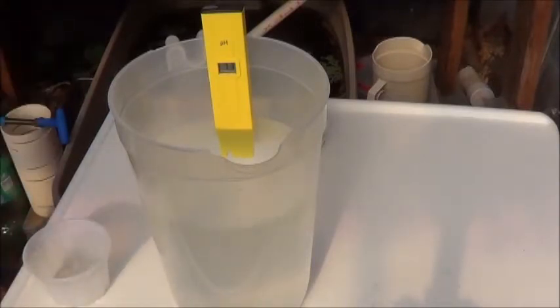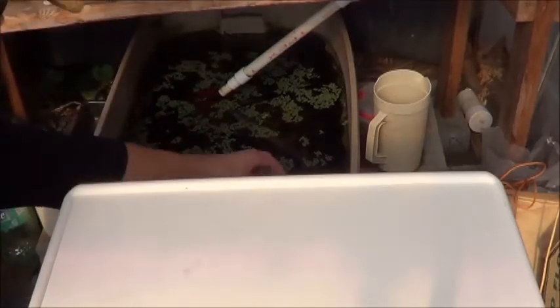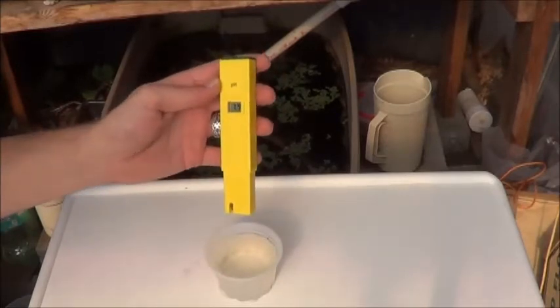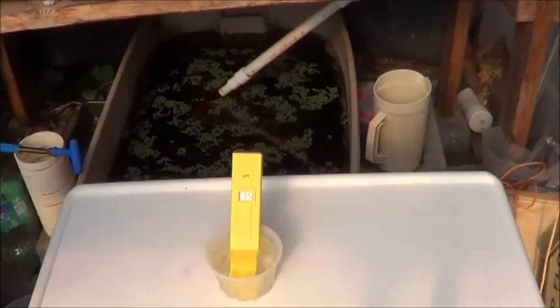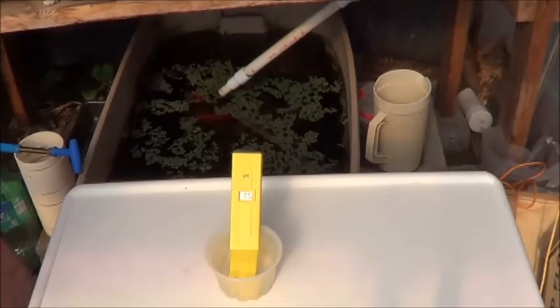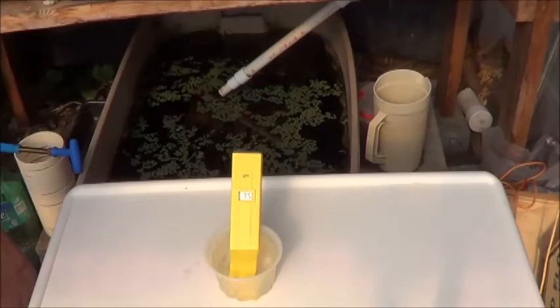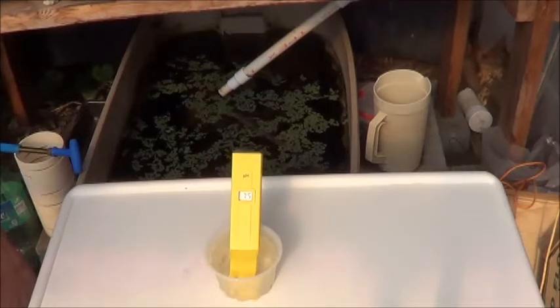Let's check what's going on in the no-power tank behind us. Let's grab my little cup here. Now, this time, the last thing the meter was in was tap water. So if it was fouled by the vinegar, we'll know that now. I'm just going to give that a minute to sit and we'll get back to it and see what it says. This jumped to 7.5 and it has just plain stayed there. I'm going to need to test the water a few more times — it is about midday right now. But what was it, 4.9 when I tested it without rinsing after the vinegar?